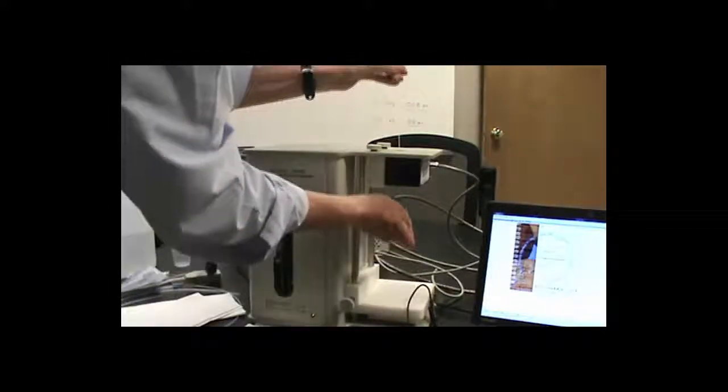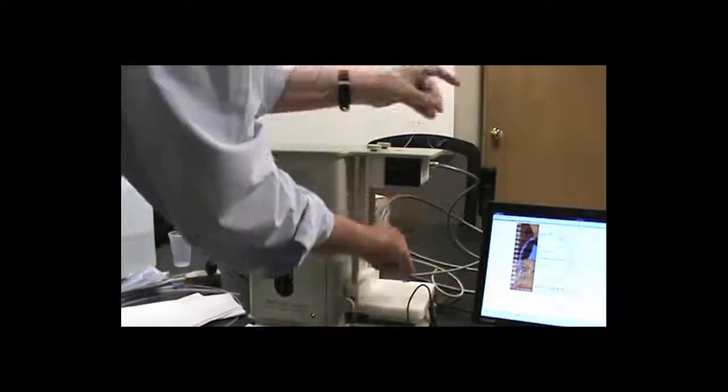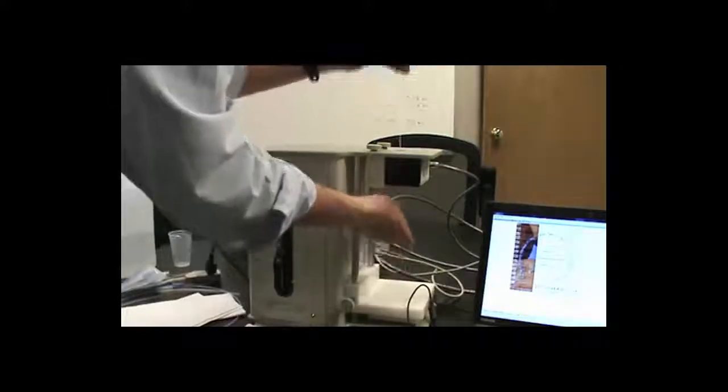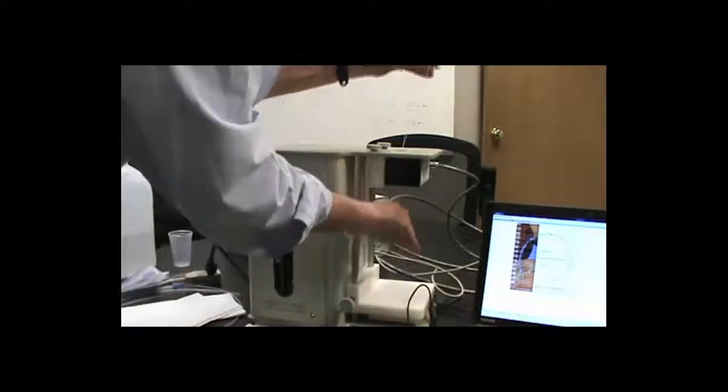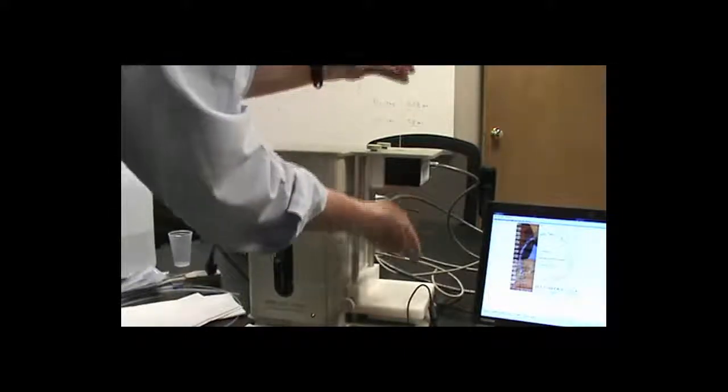Here I am going back and forth, bringing it to one side and then the other side. What we're doing is cleaning the internal surfaces of the sensor and also getting it wet, which is a good way to begin using the system.